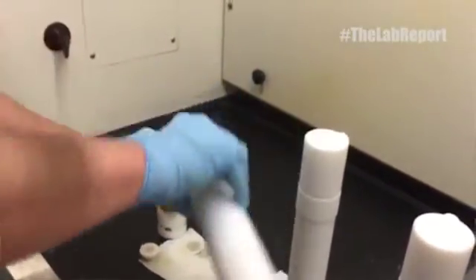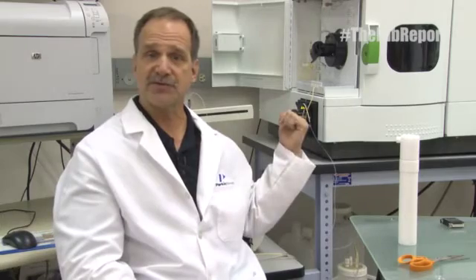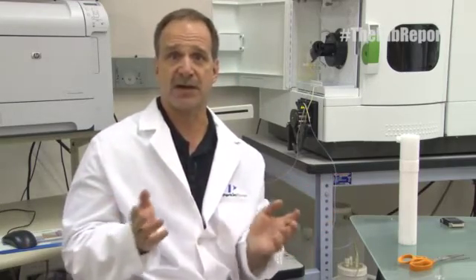Now the samples are ready for analysis by ICP-OES. We have here, right behind us, we're going to be using the Optima 8000 ICP to do this analysis and the following application that's linked into this presentation will show you all the details about it.